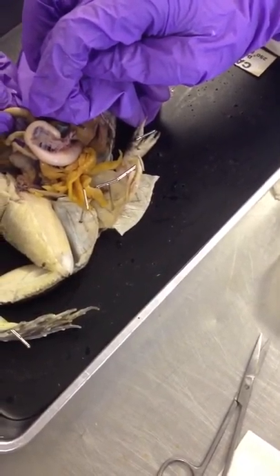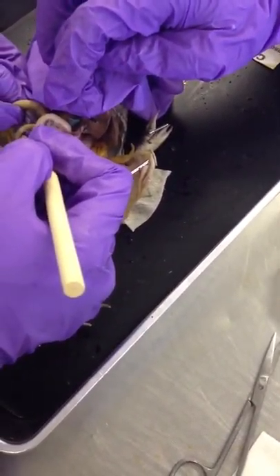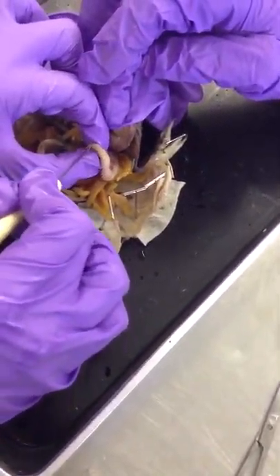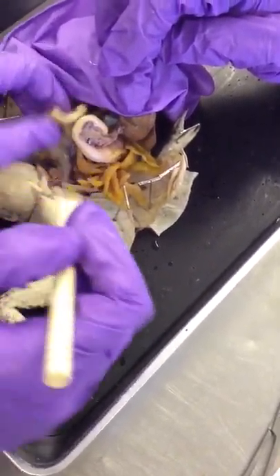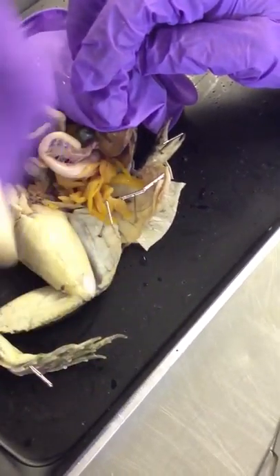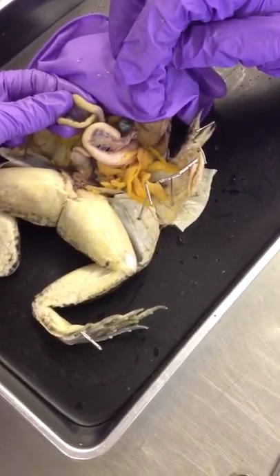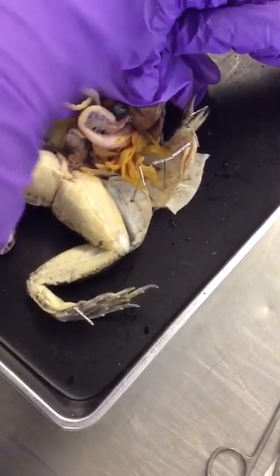In us we have duodenum, jejunum, and ileum. Frogs don't have a jejunum because they don't need as much absorption — they swallow organisms whole, so they don't process food the way we do. So we have ileum here. You see this clear film membrane? That's called mesentery. Mesentery secures the organs to the body wall and transmits blood vessels to the organs for nutrients. If these organs don't get nutrients, you get dead bowel syndrome and you're not able to pass feces.